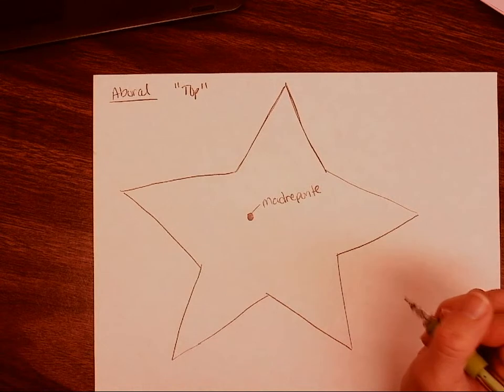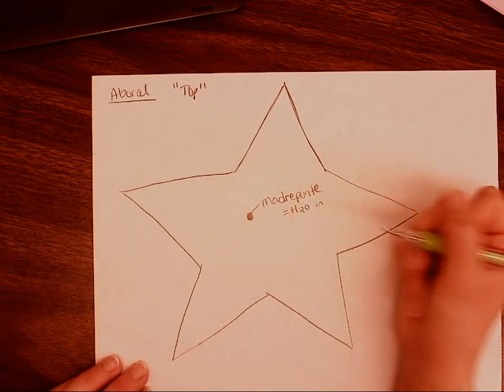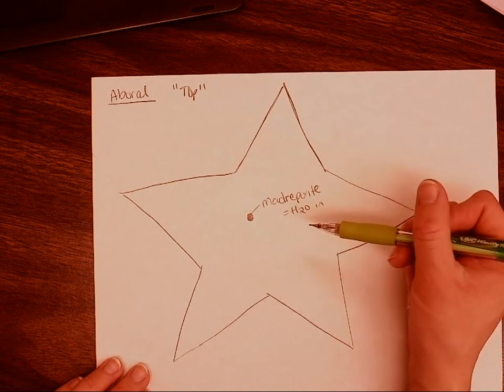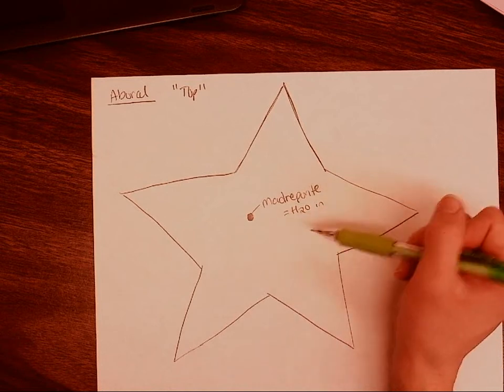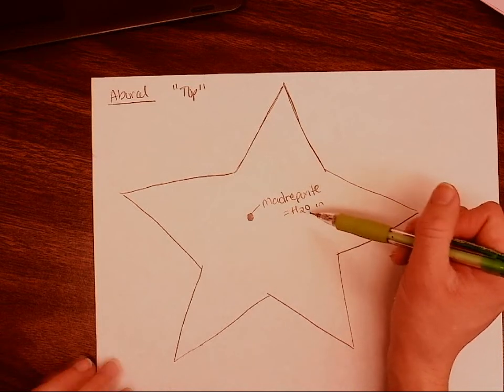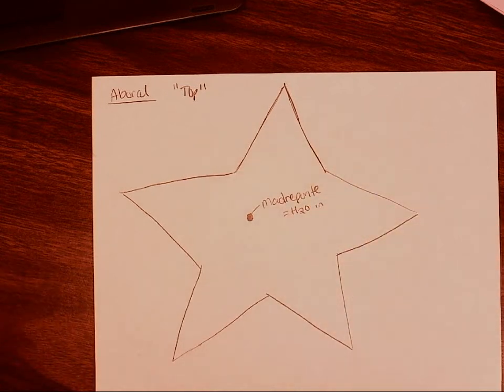And it has a really important job in that it's going to let water enter our starfish, which is going to be really, really important for having the tube feet be useful in locomotion. So it's going to allow those tube feet to move because we're going to use a water pressure system to create that suction cup that will then allow them to stick to different surfaces.